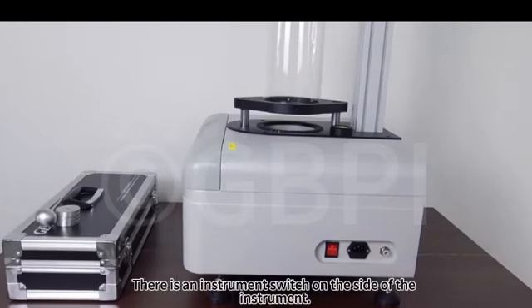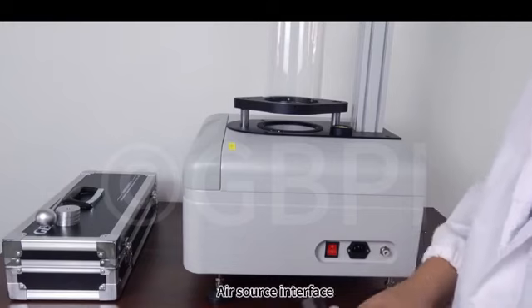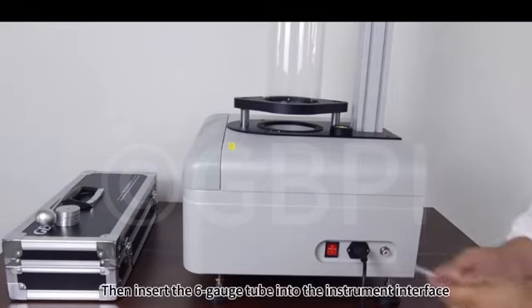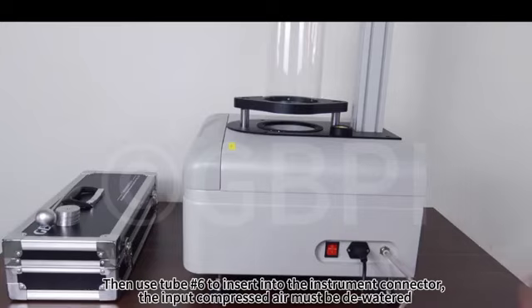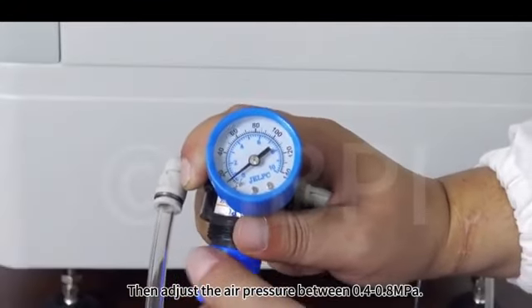There is an instrument switch on the side of the instrument. Power interface, air source interface. First we plug the power cord into the instrument. Then insert the 6 mm tube into the instrument interface. The input compressed air must be dewatered. Then adjust the air pressure to 0.4 to 0.8 MPa.